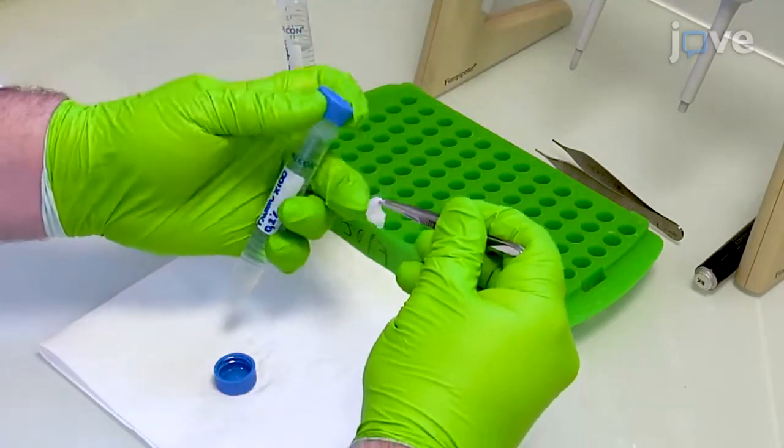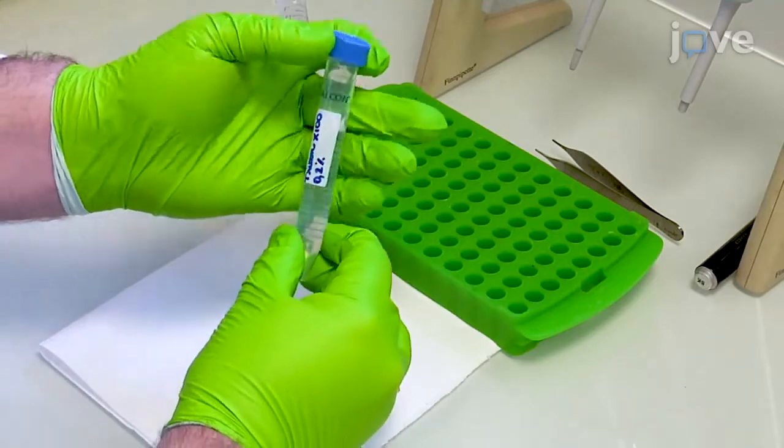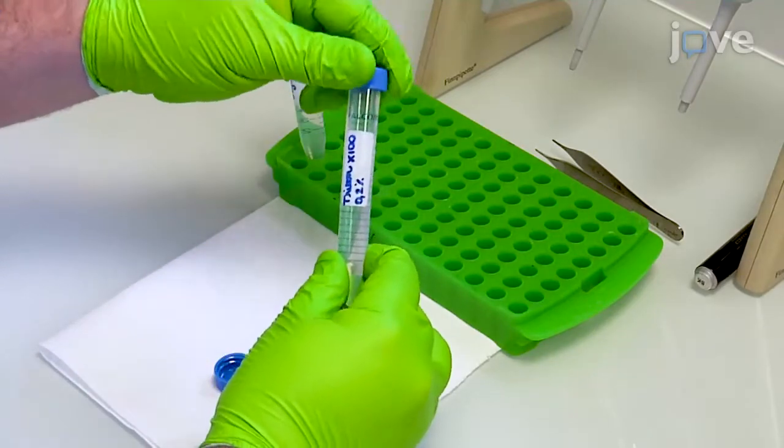Immerse the tissue in a 15 mL tube containing 10 mL of 0.2% Triton X-100 in PBS for a 2-hour incubation with shaking at 37 degrees Celsius.